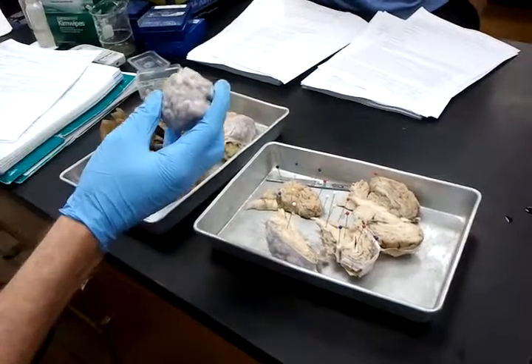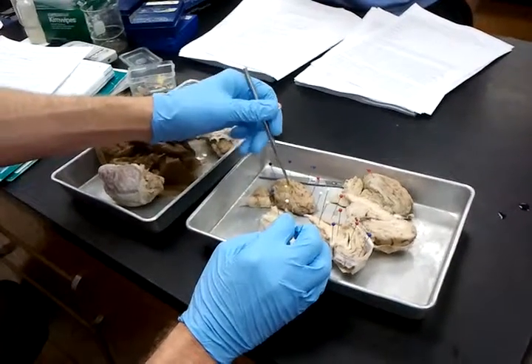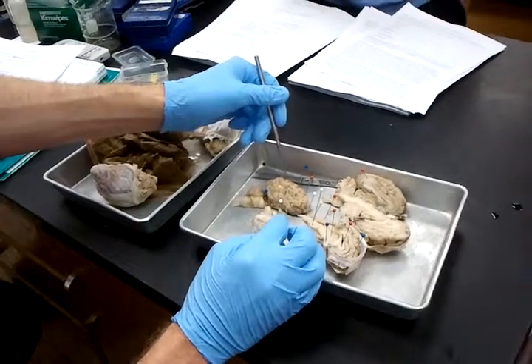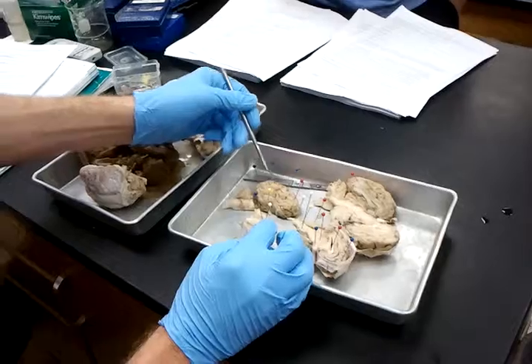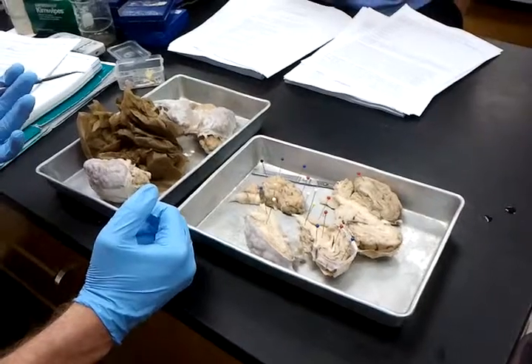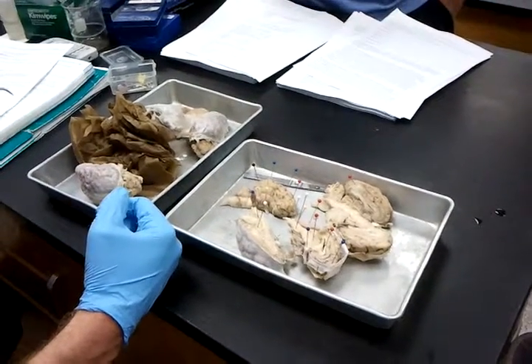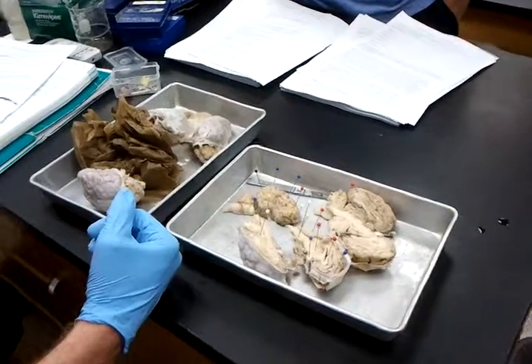The sulci, this is how I pronounce it, I'm not sure if it's right, but the sulci is the folds of the brain, so you see the darker lines basically going throughout it. That's the folds of the brain. That's what is referred to as the sulci. The gyri, so if you were to look at that fleshy part between the folds, that'd be the gyri. The ridges of the tissue is how I have it written down. So folds and the ridges between the folds, sulci and gyri.